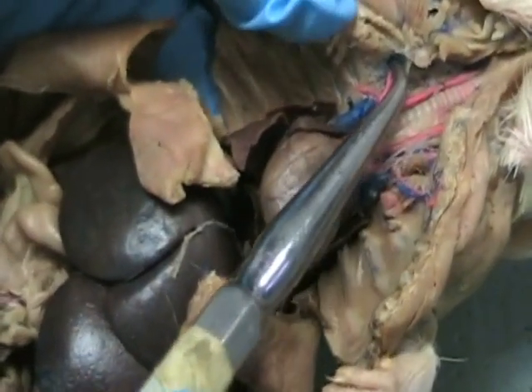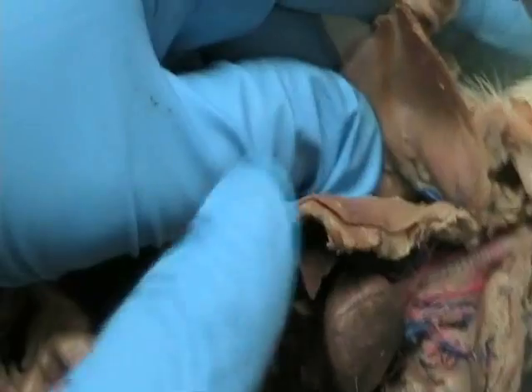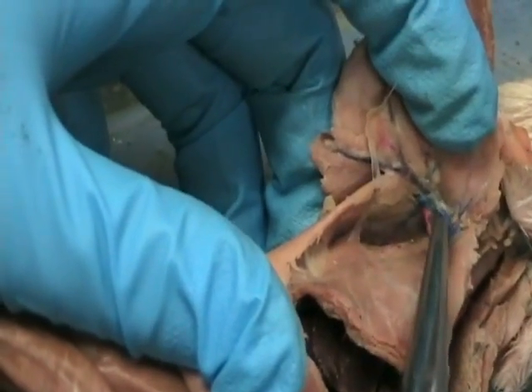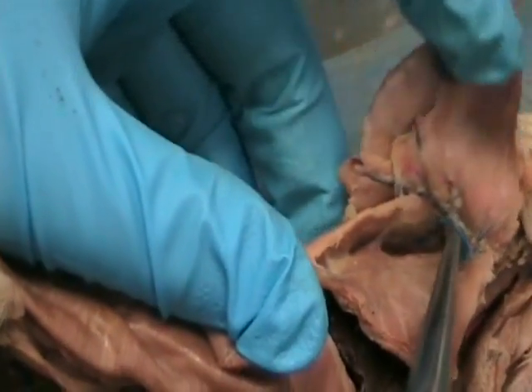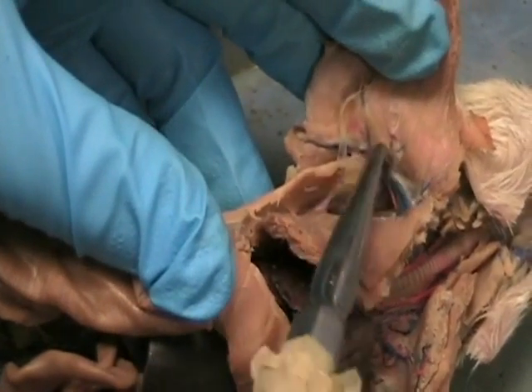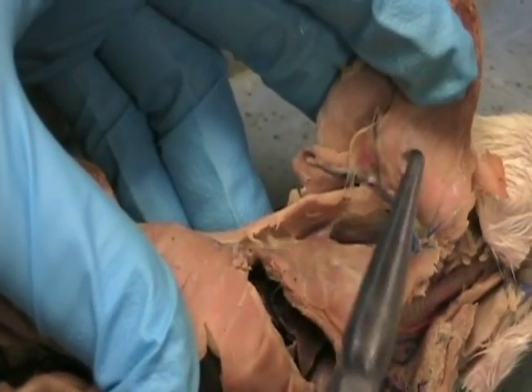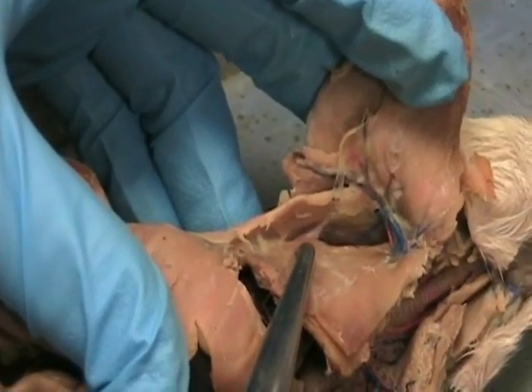Then the axillary will eventually, you can stick your probe through, go out the body wall. You can see a little bit of it down in there between the pectoralis muscle, right? And then it will split also. And the axillary will split into two parts. One part, you can only really see the vein here because the artery, I guess, is kind of stuck underneath it. But this is going to the outside of the thoracic cavity, so they call it the lateral thoracic artery.